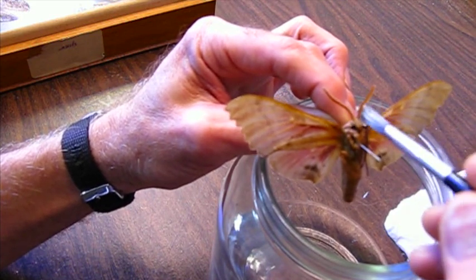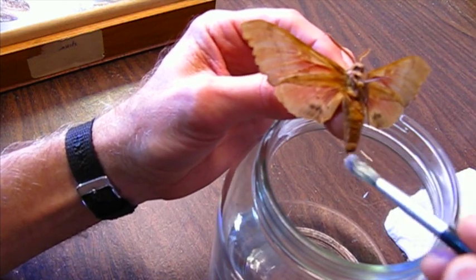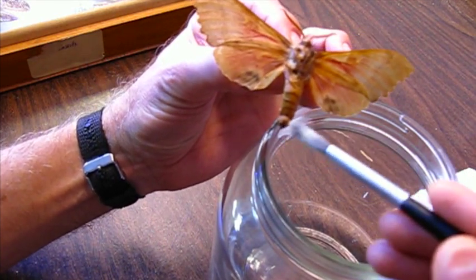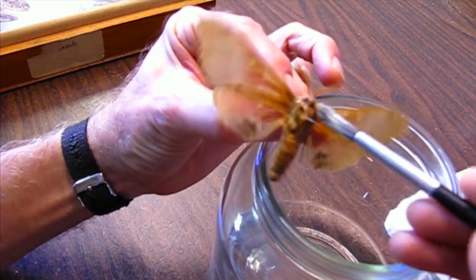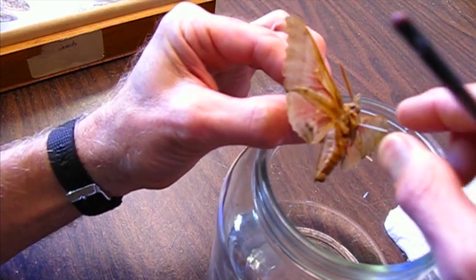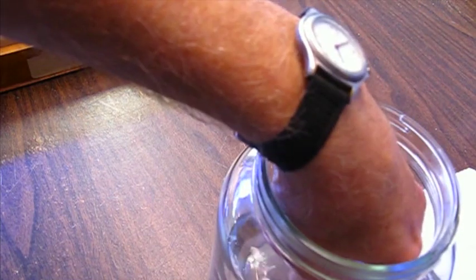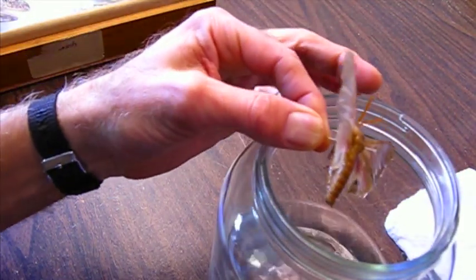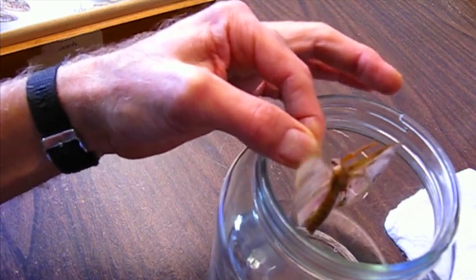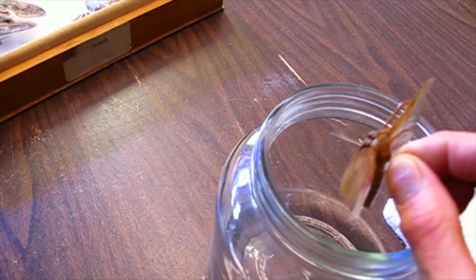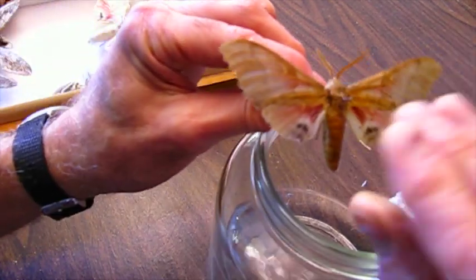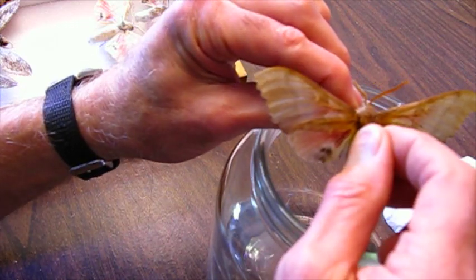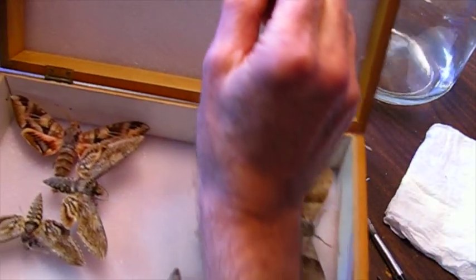I can see the little bits coming off. I'm just going to stroke the antenna gently, and then the abdomen. I can see the mold sort of rolls up like tissue paper as it comes loose. Now I'll stick this back in the acetone to rinse off the loose bits of mold and let it drip a little bit to get some of the excess off. The acetone won't relax the wings, so the wings shouldn't move out of position. I'm just going to pin it now on the back of this so it can dry.